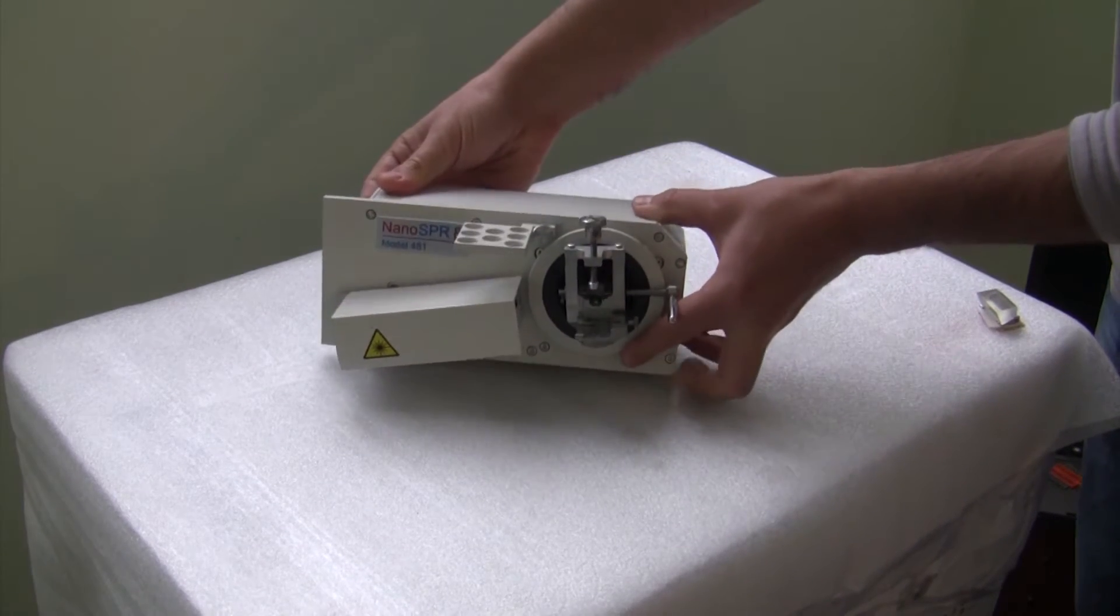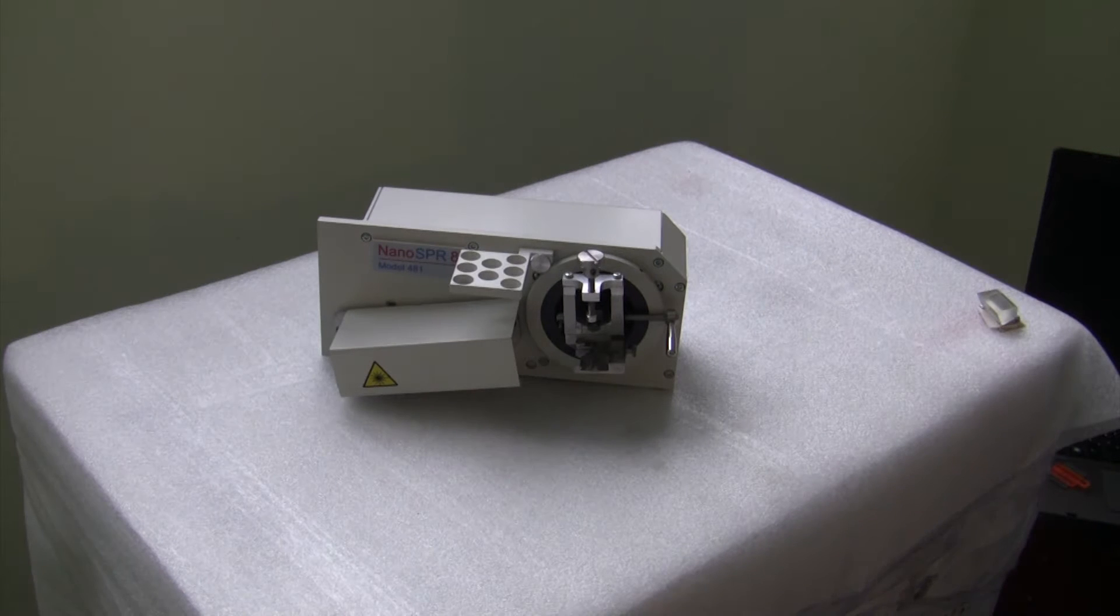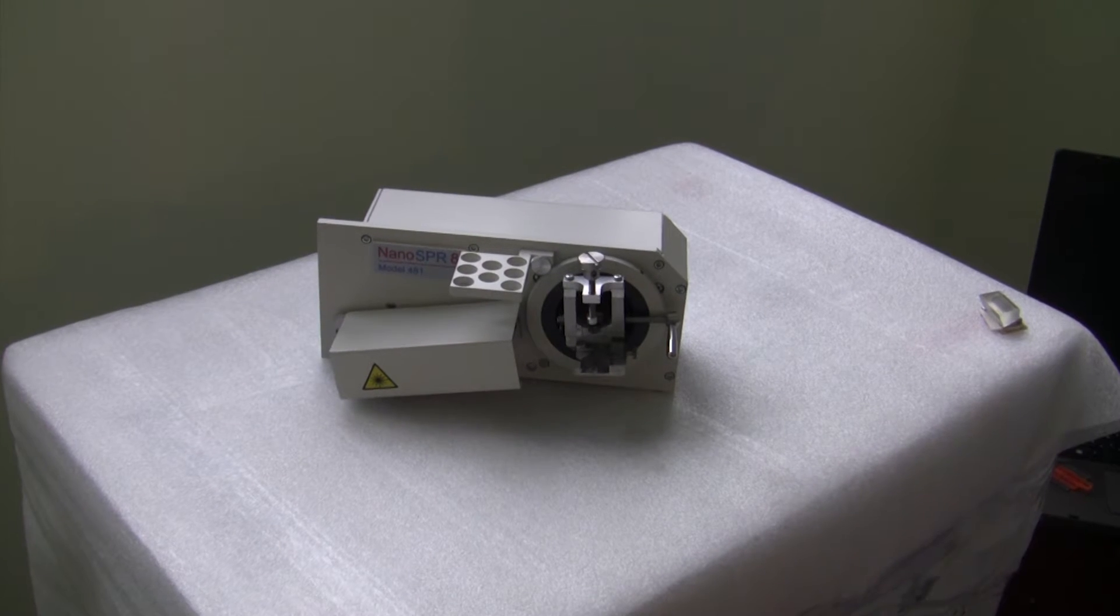In this demo, we will show the device setup, different measurement modes and will run a typical experiment.